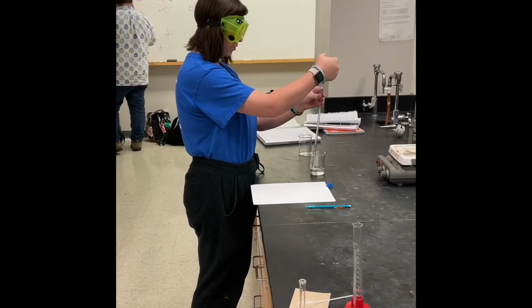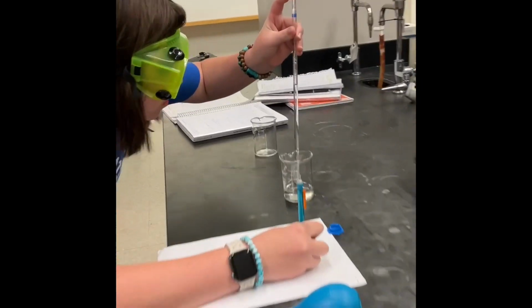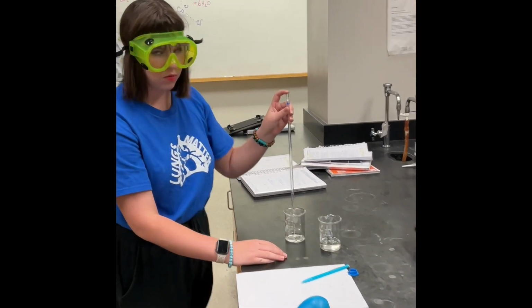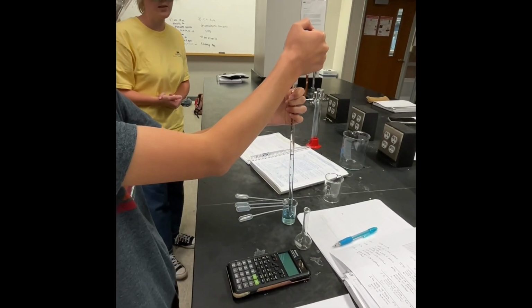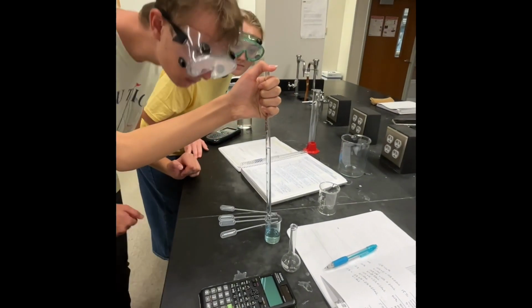Do not empty the graduated pipette completely. Record the volume of solution remaining in the graduated pipette and determine the volume of solution delivered into the beaker. Do this as many times as needed to get the intended volume, then add water until the solution is at the new volume. Weigh the solution, subtracting the beaker's original mass to get the mass of the solution.